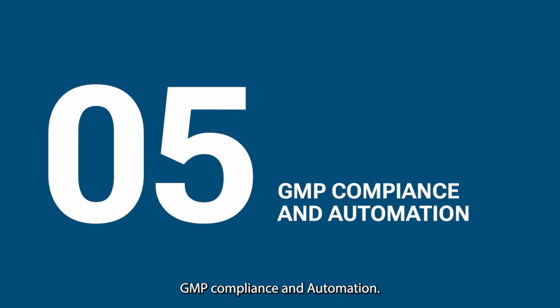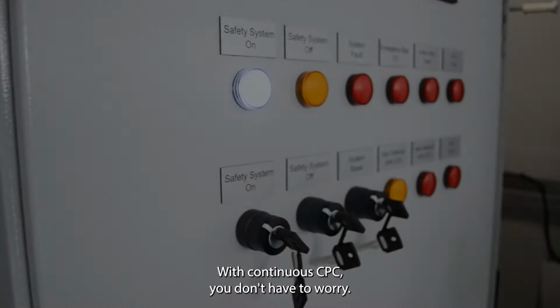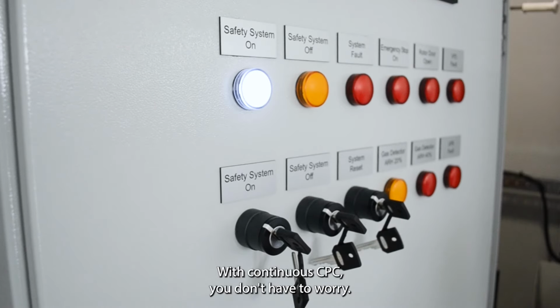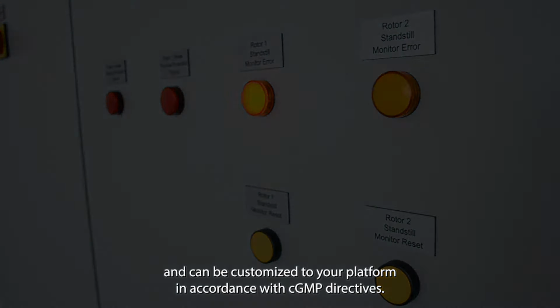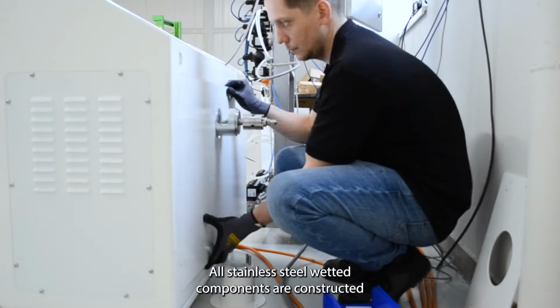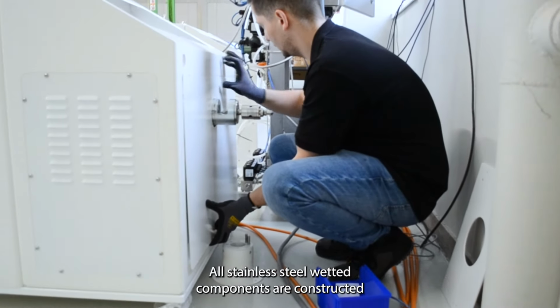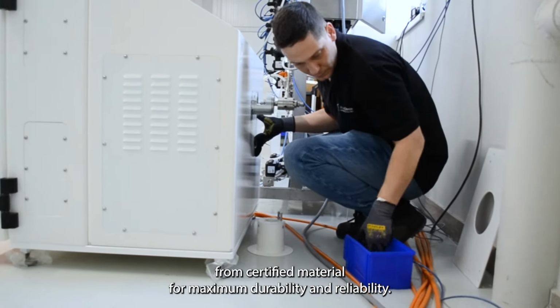GMP compliance and automation. Compliance is another crucial aspect of any production process. With continuous CPC, you don't have to worry. The platform comes with a variety of compliance specifications and can be customized to your platform, in accordance with cGMP directives. All stainless steel wetted components are constructed from certified material for maximum durability and reliability.